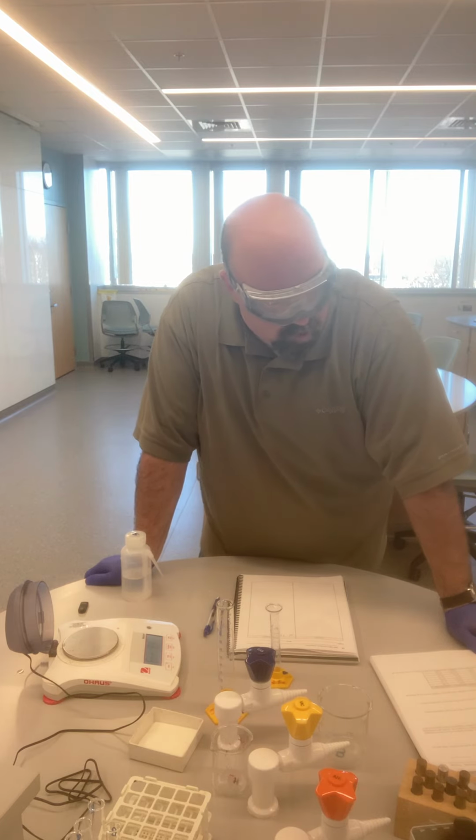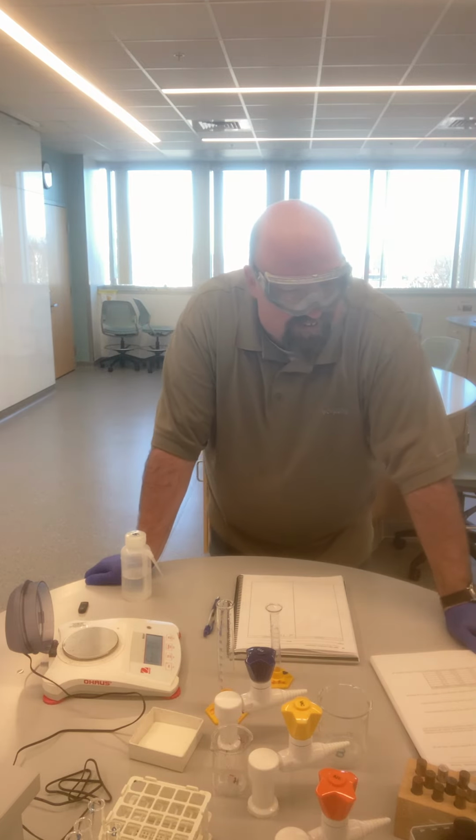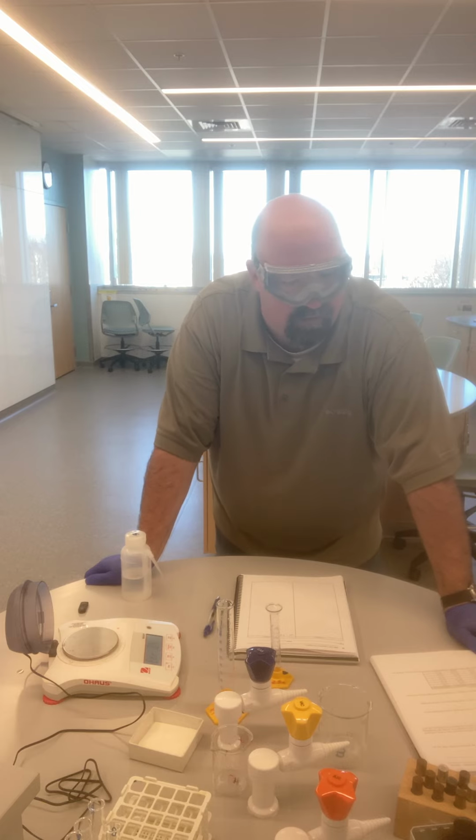And so what we're going to do is find the densities of these various liquids and a couple of solids. And you're going to use that table on page 13 to then try to identify what the substances actually are. Now we probably won't get any that are dead on. For instance, if you found the density of something to be 7.94, then the closest to that is iron with a density of 7.86. With our tools here, we're not going to get any of these dead on, but you're going to look for what the closest one is, and it should be hopefully pretty close.